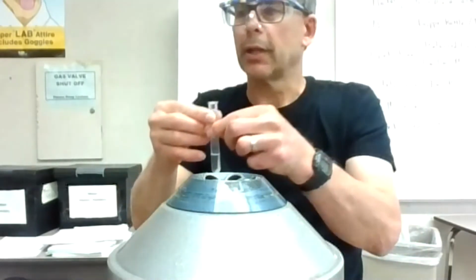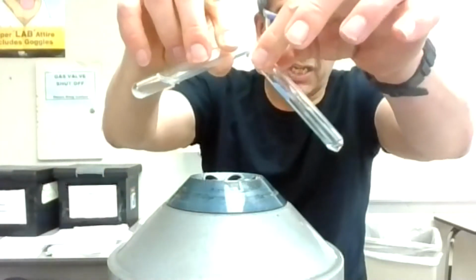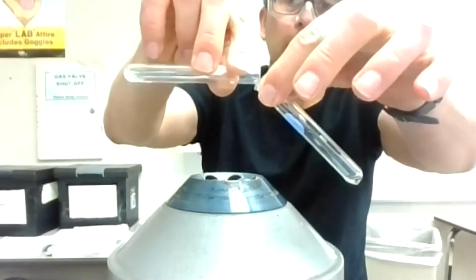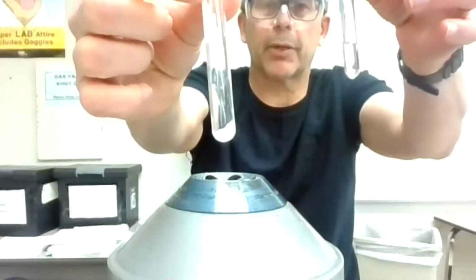Okay, so that is going to allow for a nice transfer. And I'm just going to decant it. Okay. And I'm going to do that. I might leave a drop of liquid, but I keep that solid there. So that's my magnesium or magnesium hydroxide. I don't care about that. This would contain the calcium and strontium and barium if we had it. And we know we had it because we put all those things in.